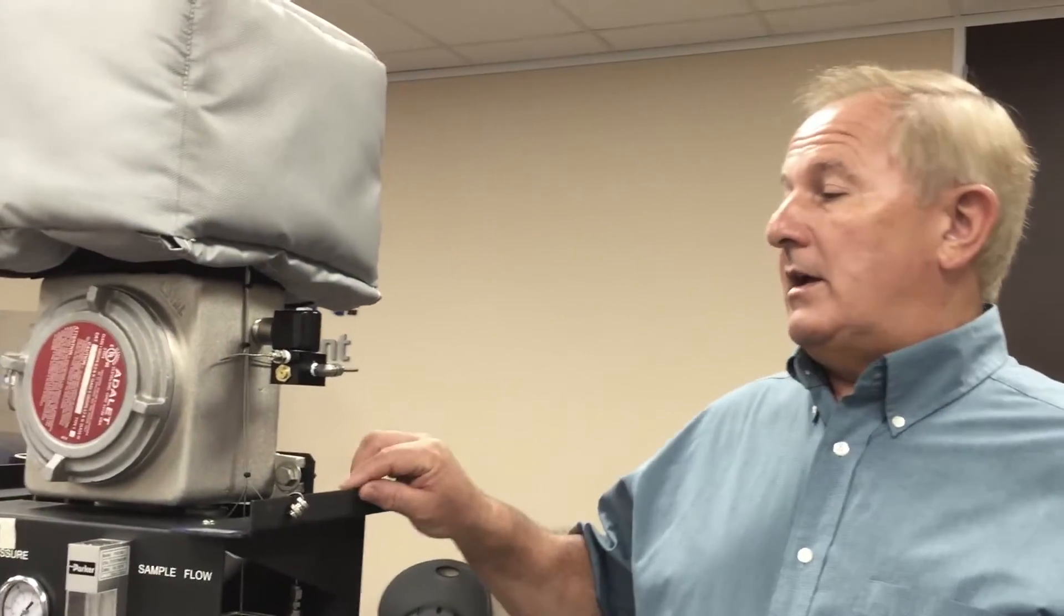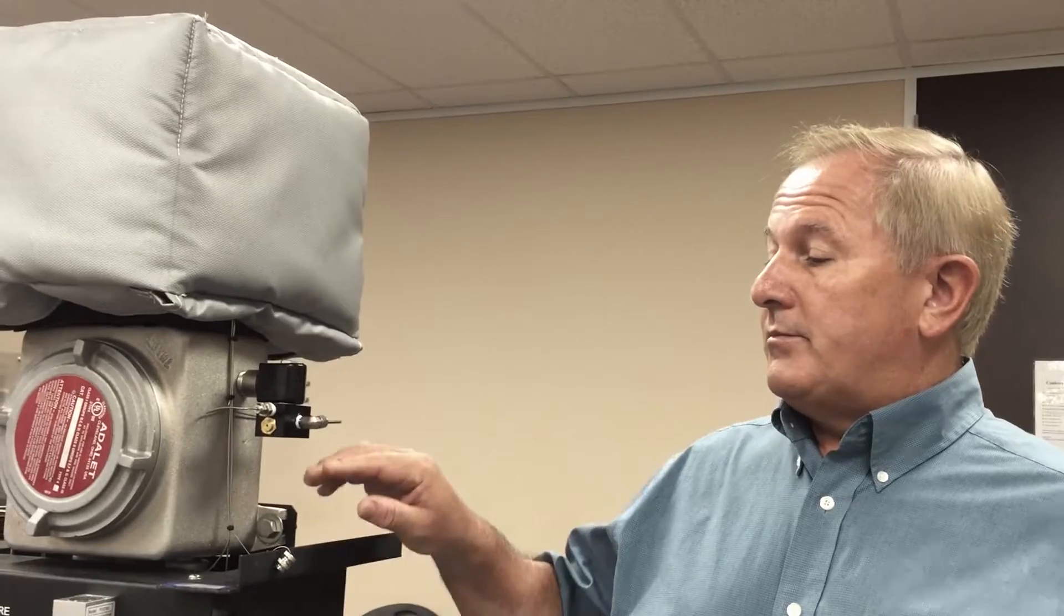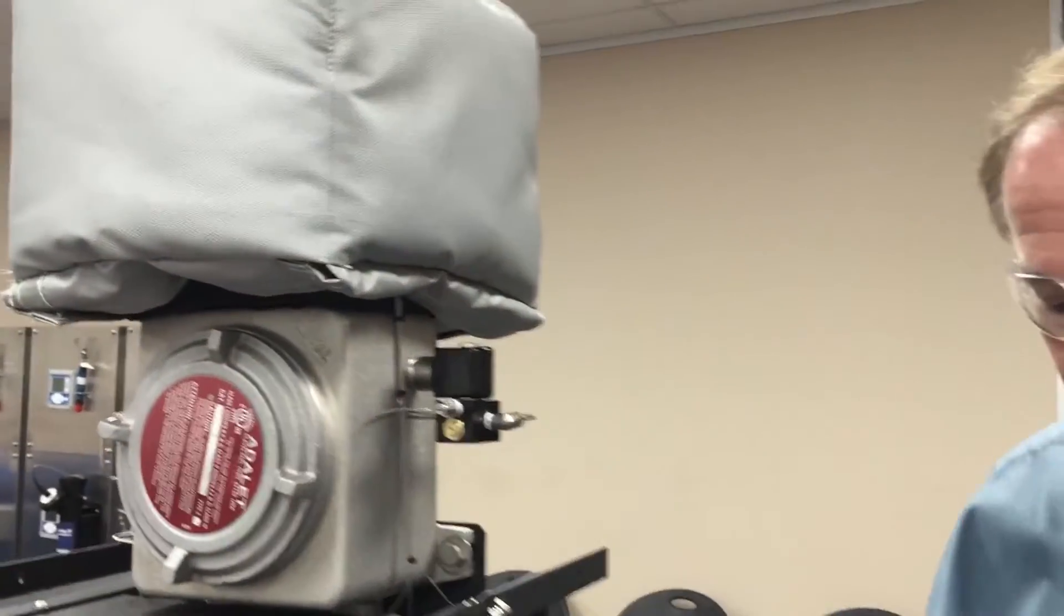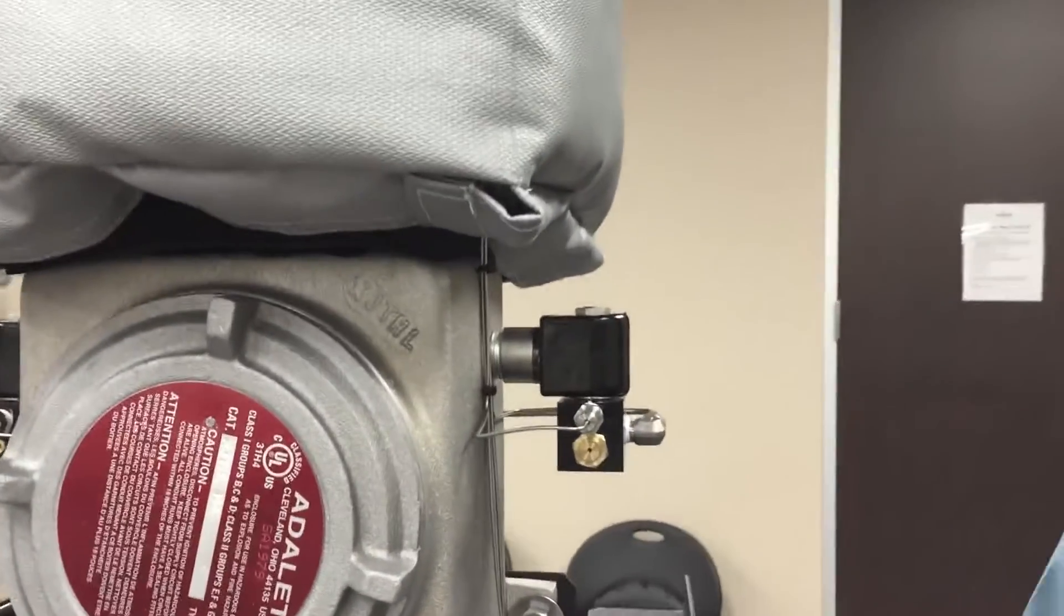Before you begin the upgrade, make sure there's no power going to the GC, and secondly, the pneumatics have been depressurized.